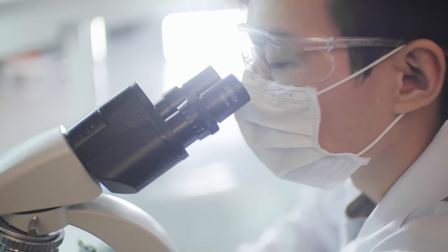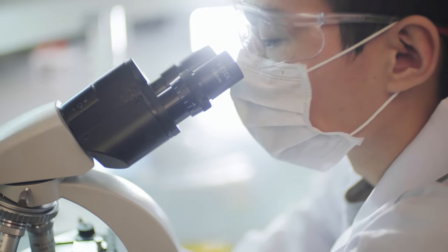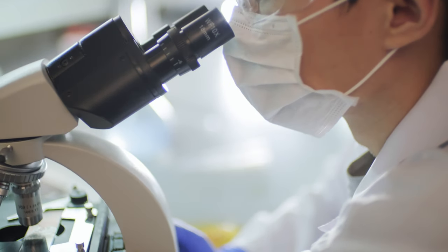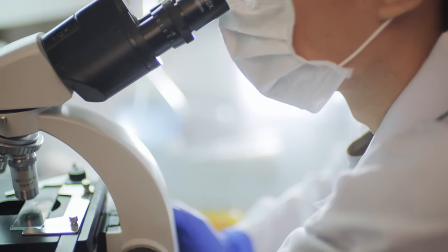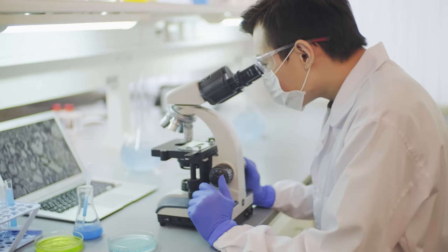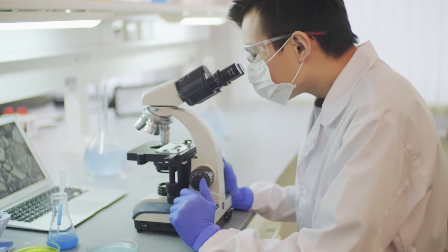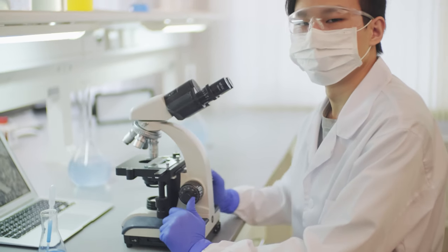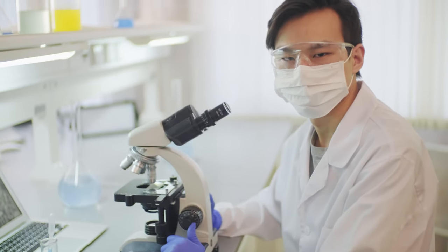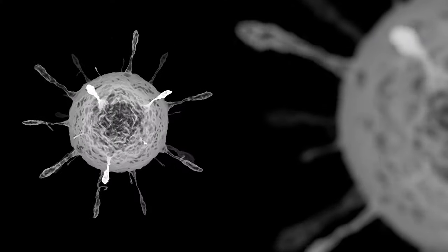Today we will cover a lot of interesting things: look at a real electron microscope, find out why it's needed at all, figure out how to magnify something by hundreds of thousands of times with the help of electrons, and tell you how science learned to see a single atom. Everything detailed and clear.